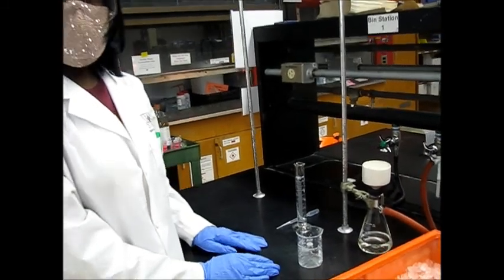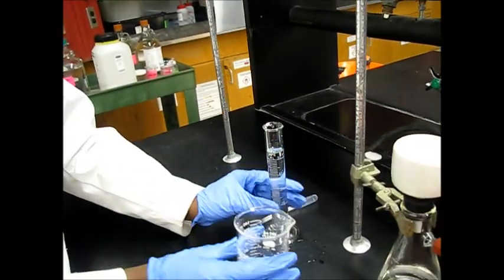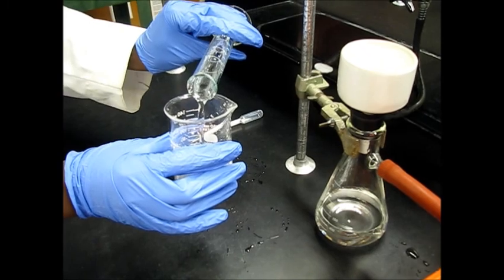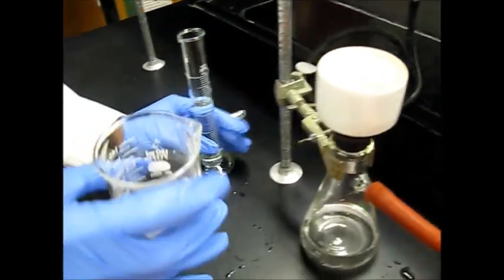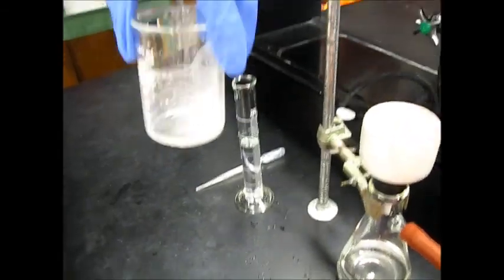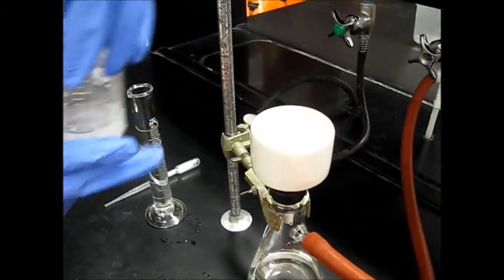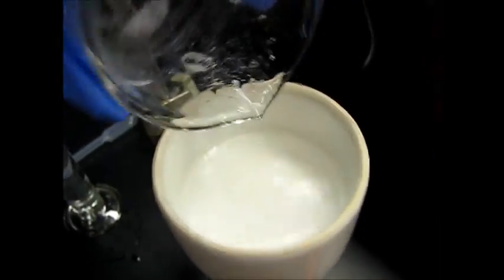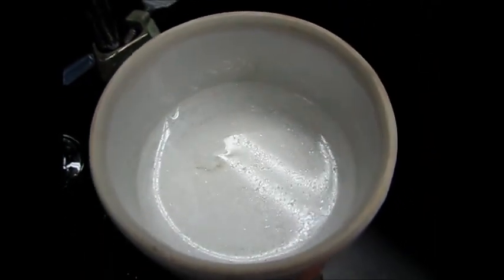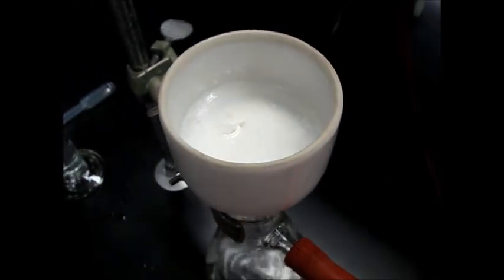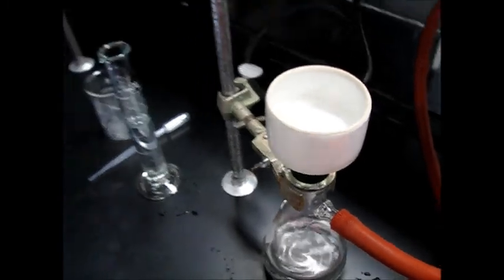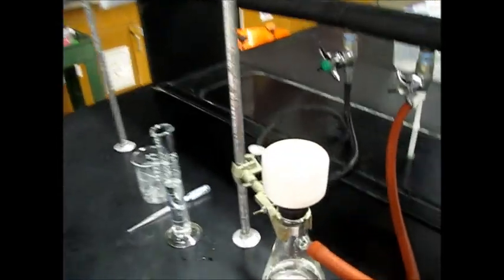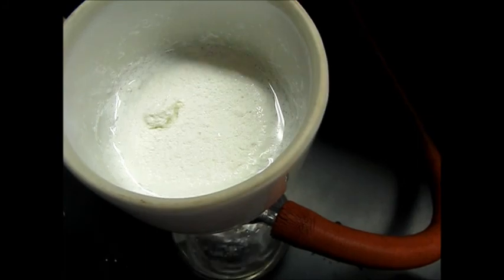Now we're going to rinse it with water. So I'm going to get the rest of this out of this beaker. It's about 20 mL of water. I'm going to shake it. I'm going to rinse the powder. And now we're going to allow this to air dry for 15 minutes. Okay, we'll come back after 15 minutes.